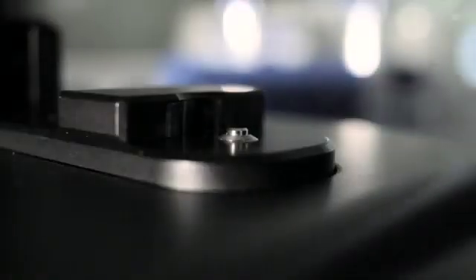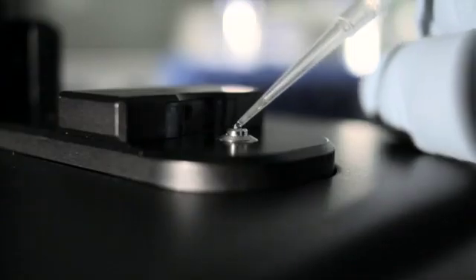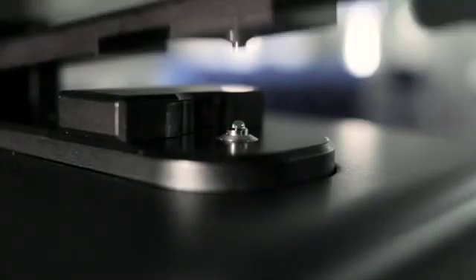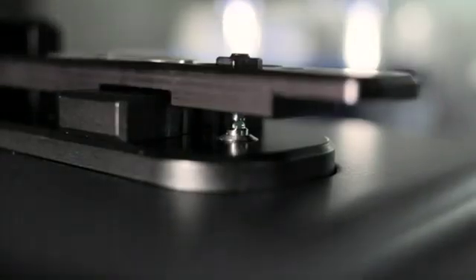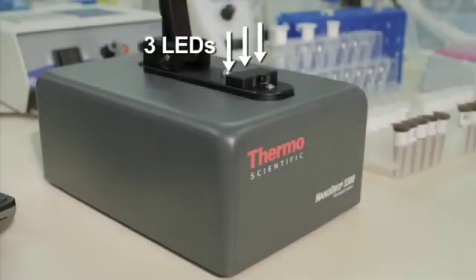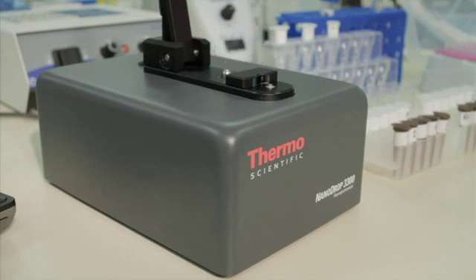The Nanodrop-3300 fluorospectrometer employs the same patented microvolume sample retention system as the Nanodrop-2000 spectrophotometer, with fluorescence measurements being performed with as little as 1 microliter of sample. The user chooses one of 3 LEDs as the excitation source, which fires at the sample horizontally. The subsequent sample fluorescence is then collected at a 90-degree angle vertically into an internal spectrometer.